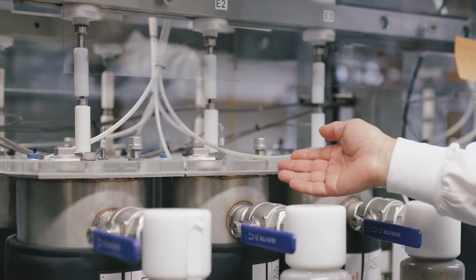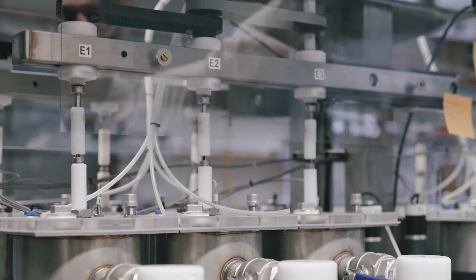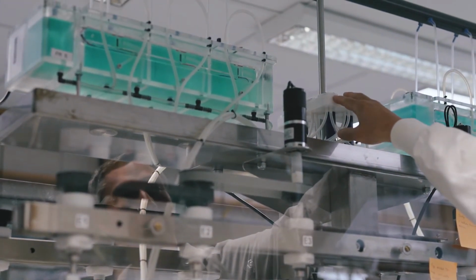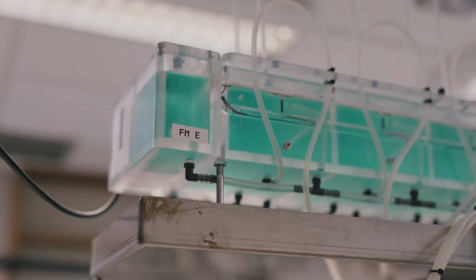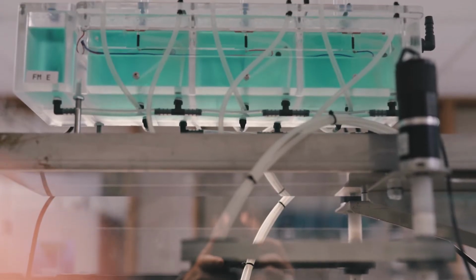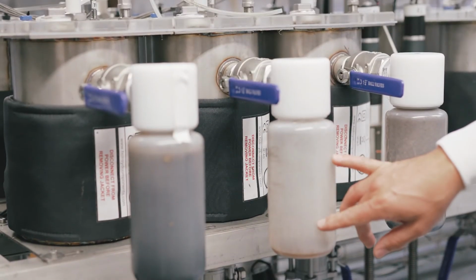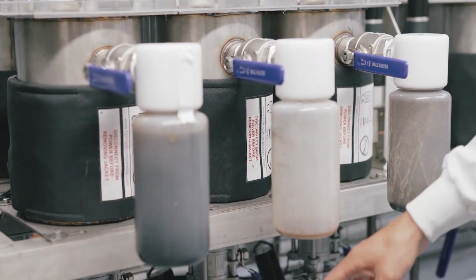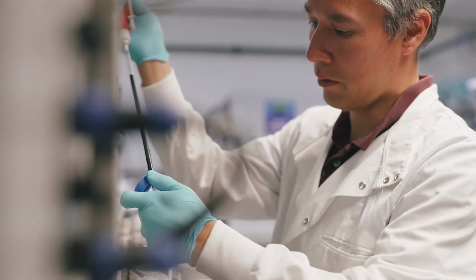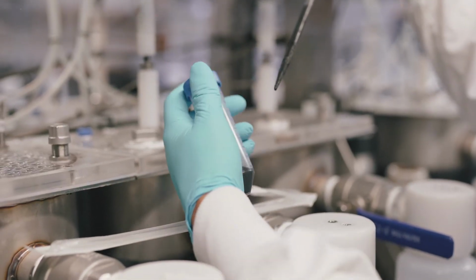The material is added. The gas comes out through these pipes. We can monitor the composition of the gas, so we can measure methane and carbon dioxide concentrations. We can also measure the volume of gas being produced as it comes through these tip buckets, and then that's vented out of the room safely. Any extra material that isn't broken down into gas spills over and it's collected in these pots. And that means that we can analyze the sample from the material that we're putting in to the material that's coming out, as well as monitoring what's happening to the microbiology inside the system.